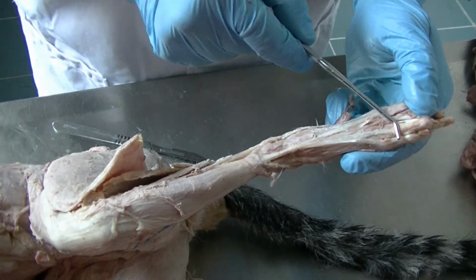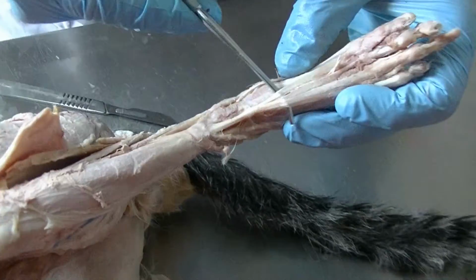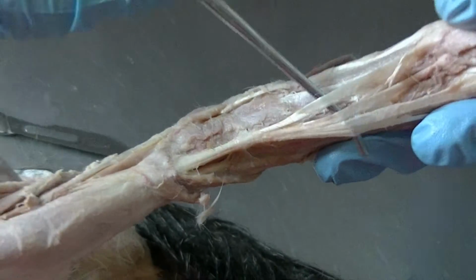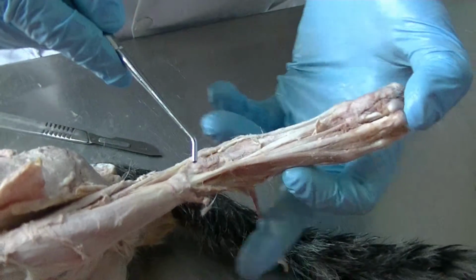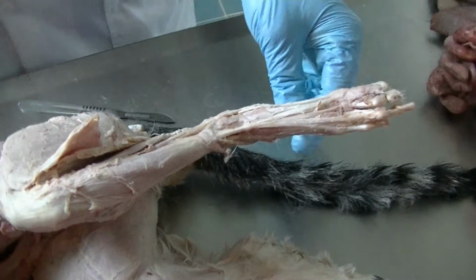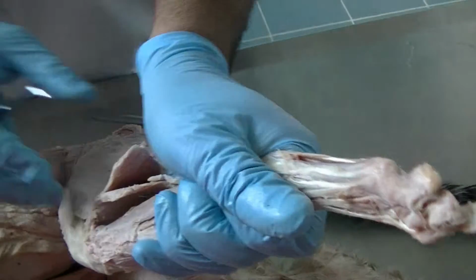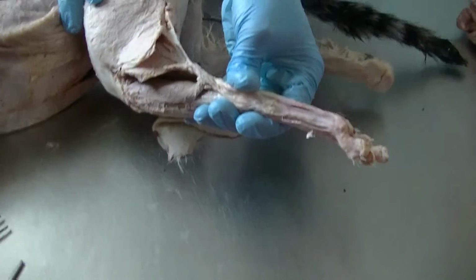The long digital extensor is called long because there is a short digital extensor located below the tarsus, and that is why we see 2 different sets of tendons going on the dorsal aspect of the digit. It's because of the long digital extensor and short digital extensor. The short digital flexor muscles are also reported in the cat. Those would be present along with the digital flexor muscles on the caudal surface.